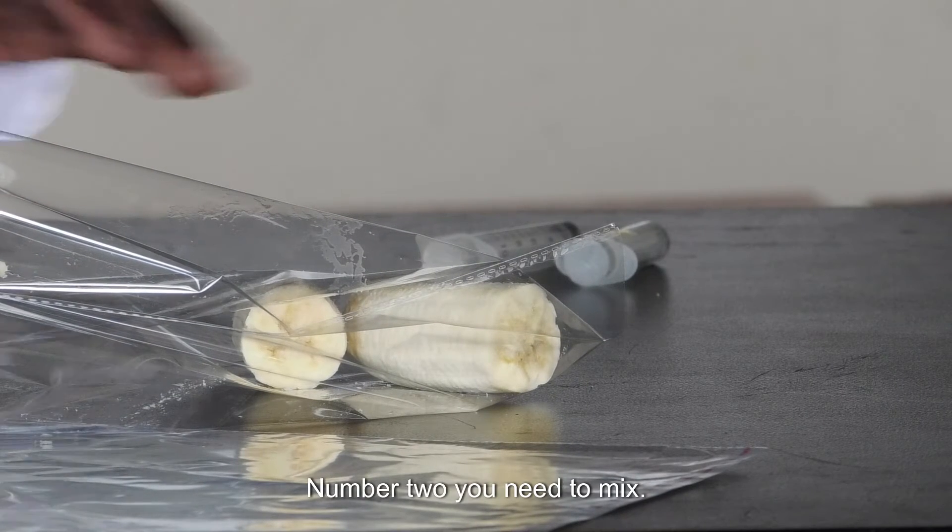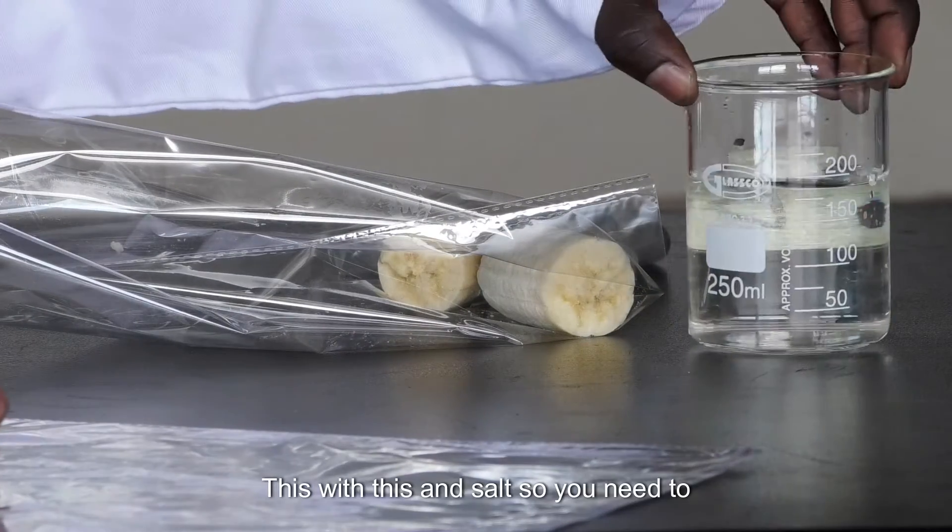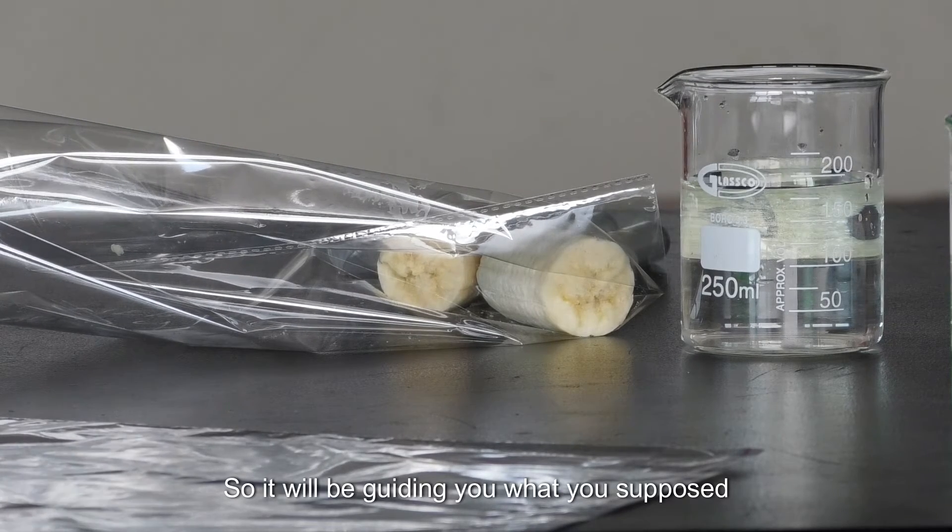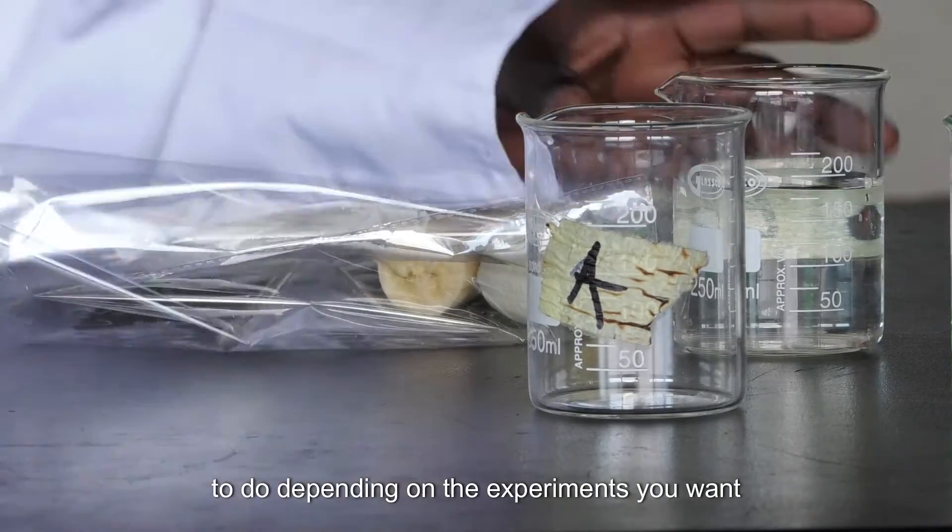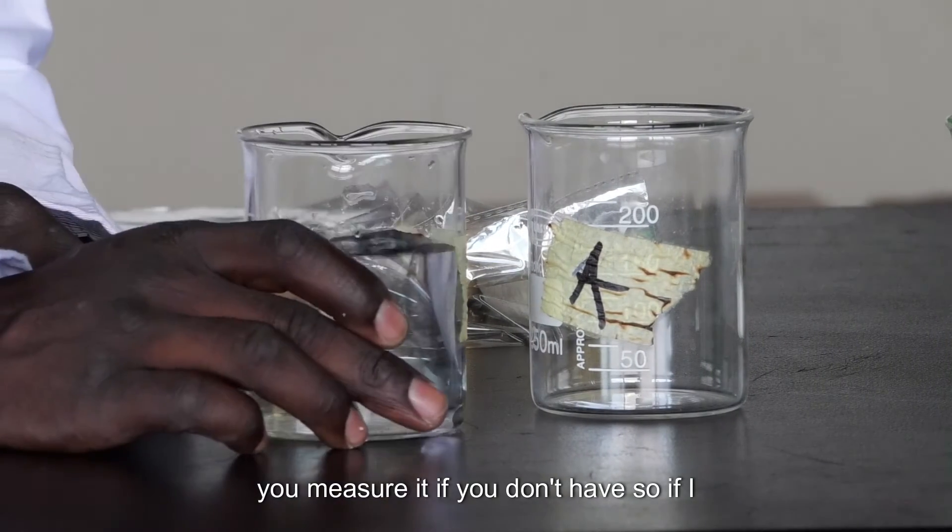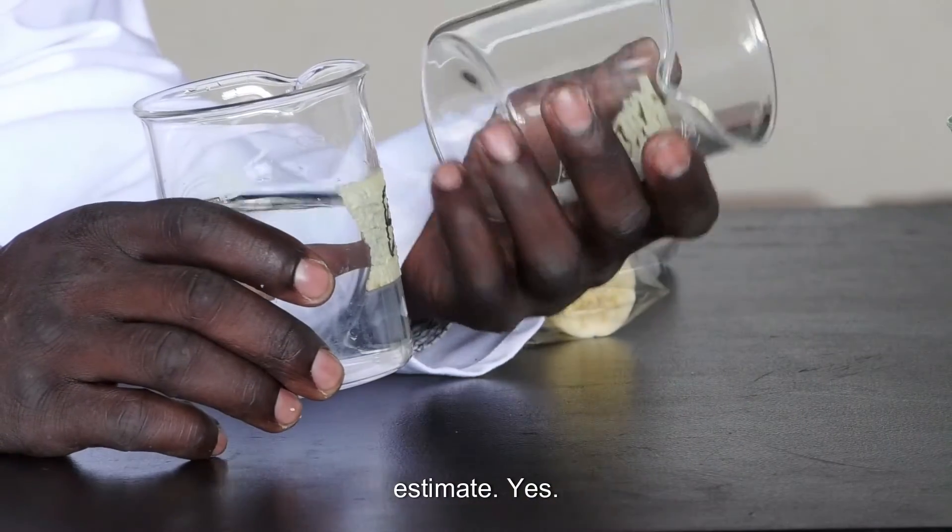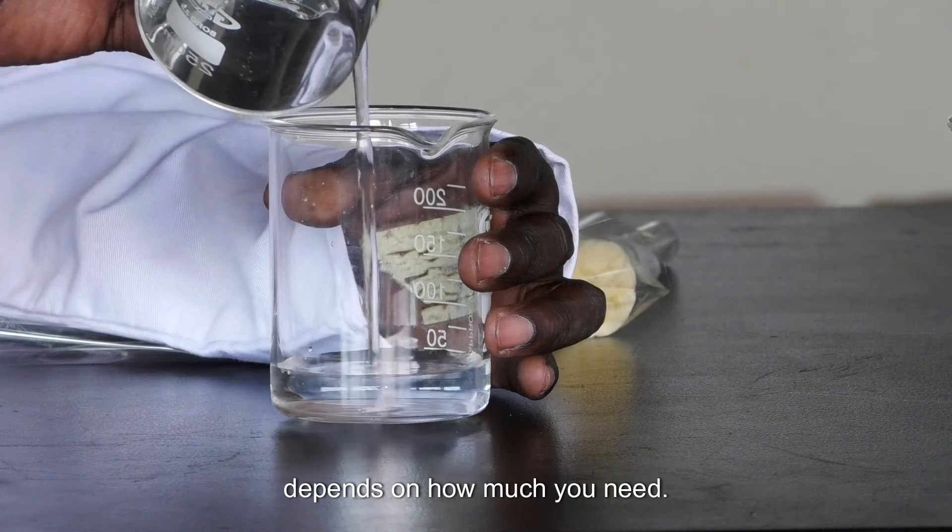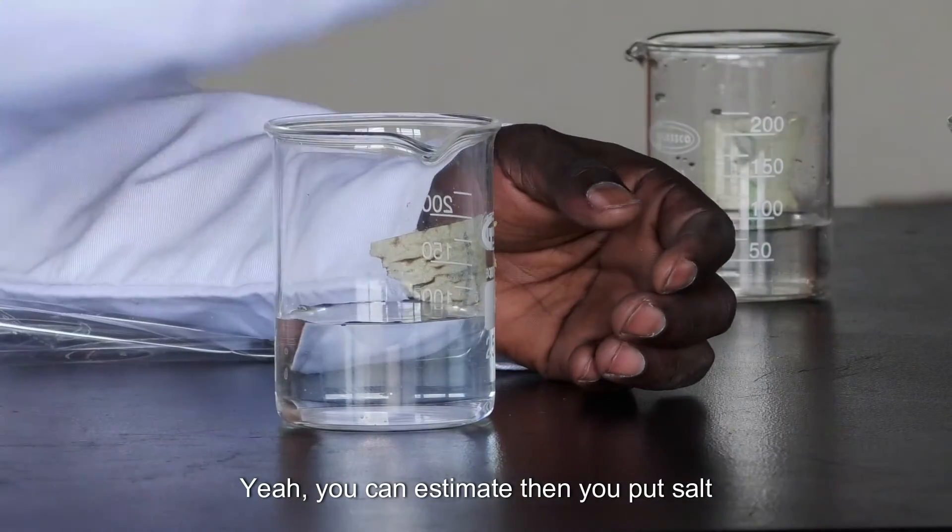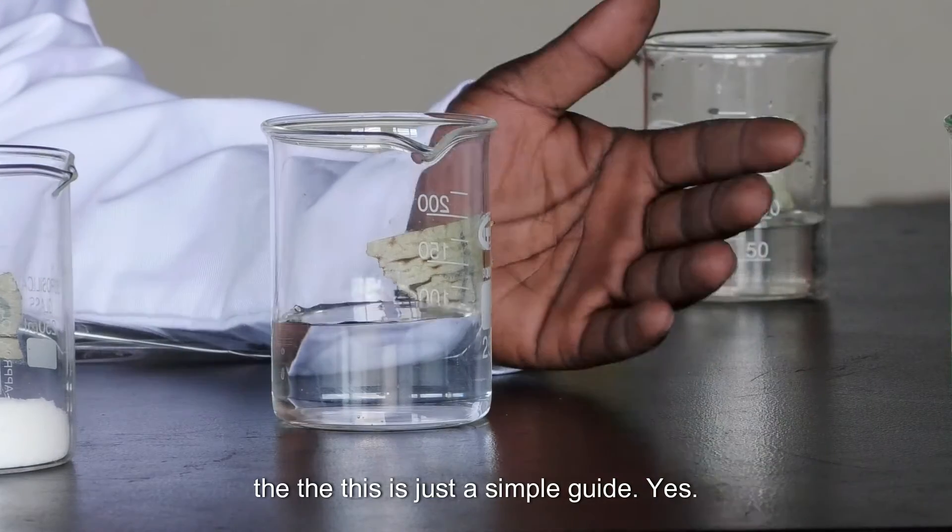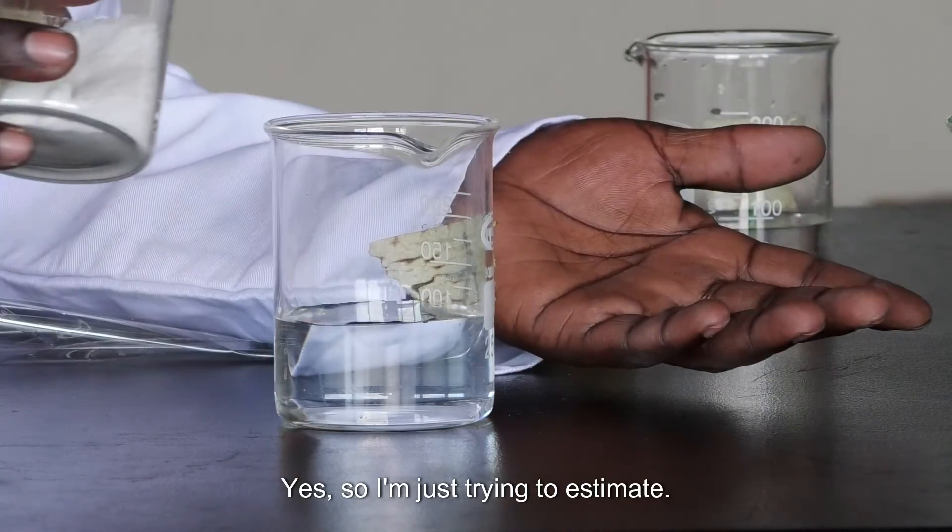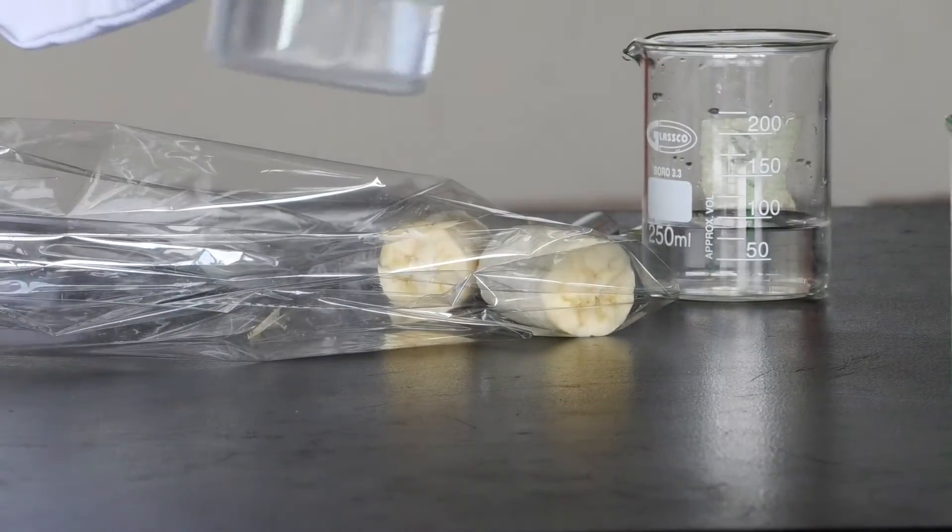Number two, you need to mix this with this and salt. So you need to measure, you have to be able to measure a specific concentration. So it will be guiding you what you're supposed to do depending on the experiment you want to do. But if you don't have how you measure it, you can just estimate. Maybe that one is enough.